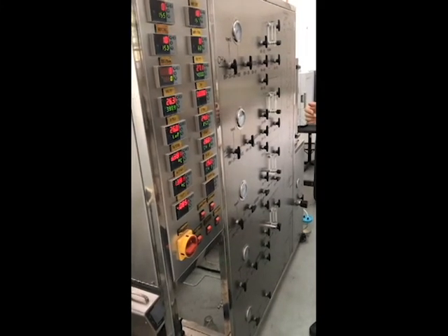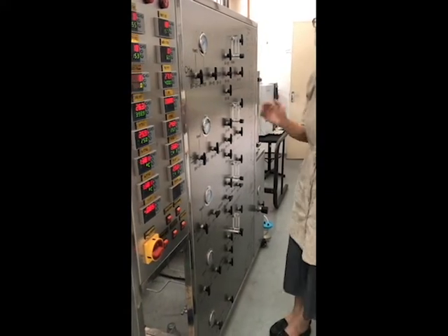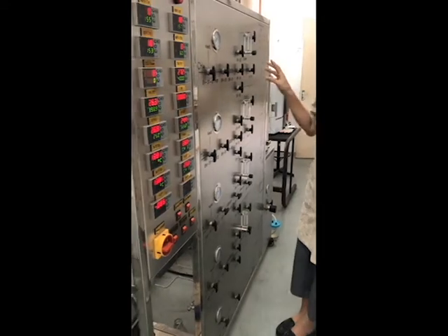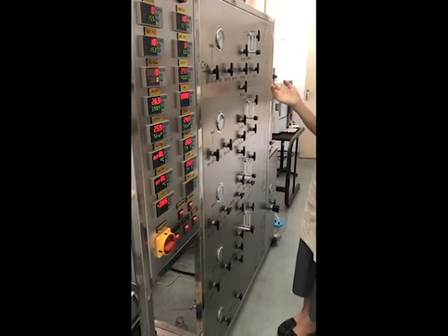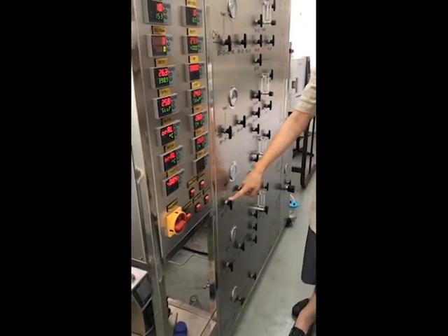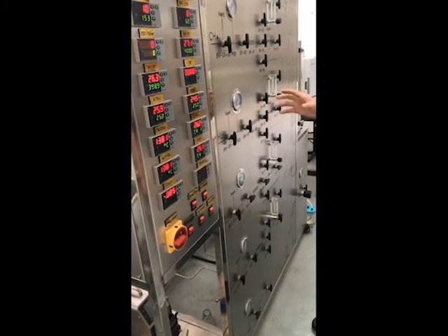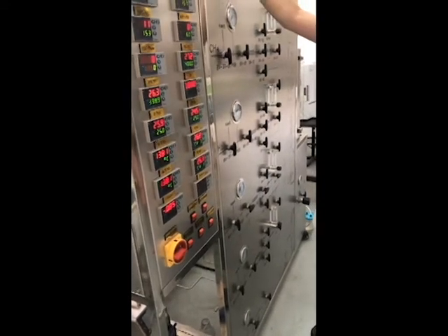The principle for the gas supply is: first, you need to remove your residue gas, either from the air or from the last reaction. So every time we charge nitrogen first. Nitrogen, because we are only using the flow, we don't care about pressure. So we go out to turn on your gas.